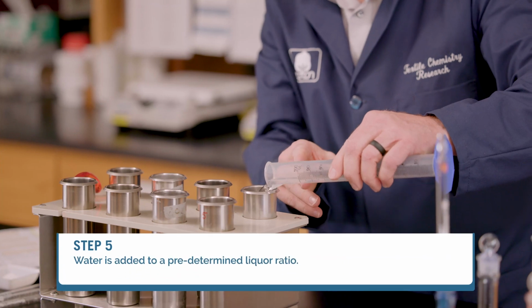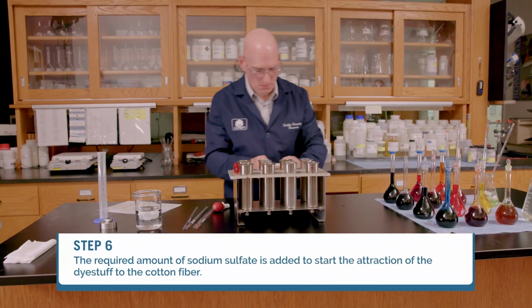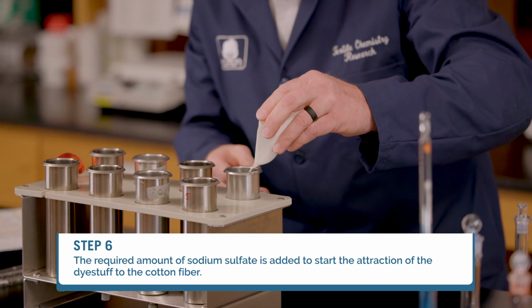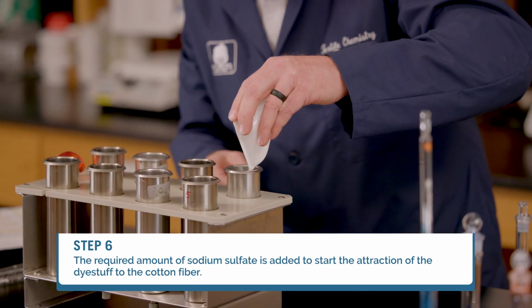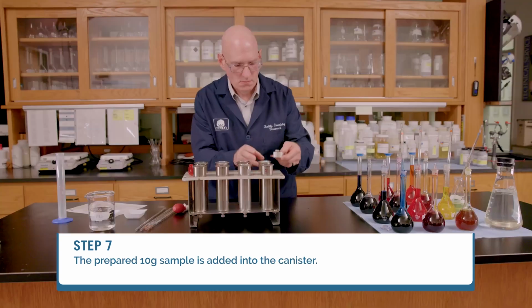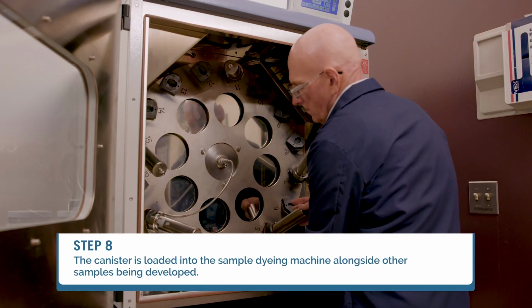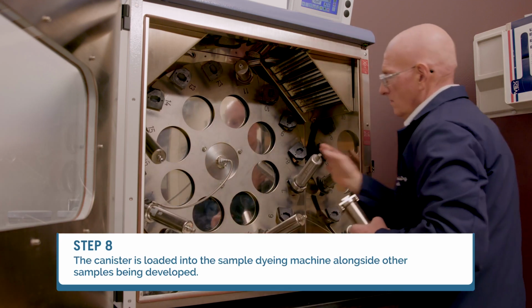Water is added to a predetermined liquor ratio. The required amount of sodium sulfate is added to start the attraction of dyestuff to the cotton fiber. Finally, the prepared 10-gram sample is added into the canister. The canister is loaded into the sample dyeing machine alongside other samples being developed.